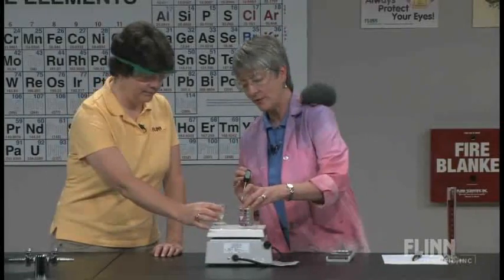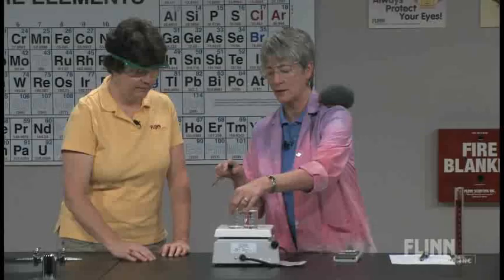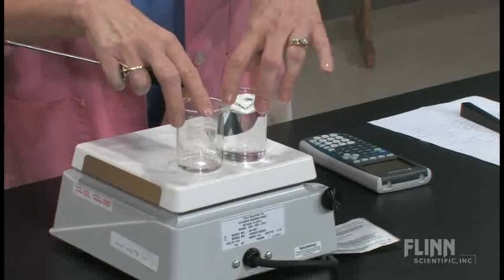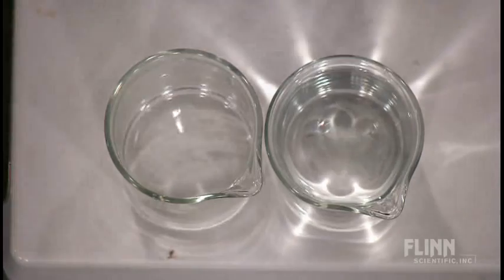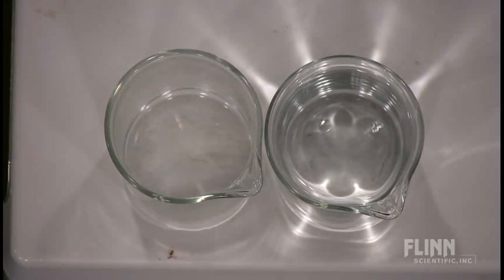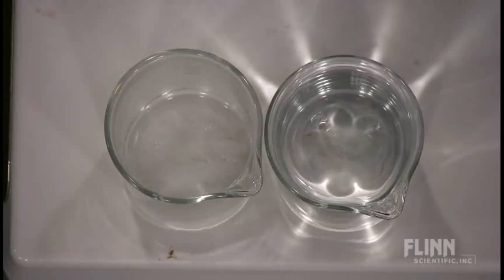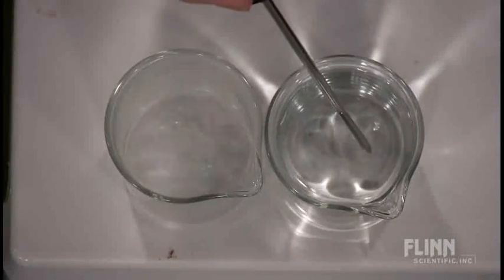And if you could just put that on there. Until it starts boiling, you don't have to do anything. I see little bubbles, but not boiling. I think it's boiling, Annis. Okay, 27.7.